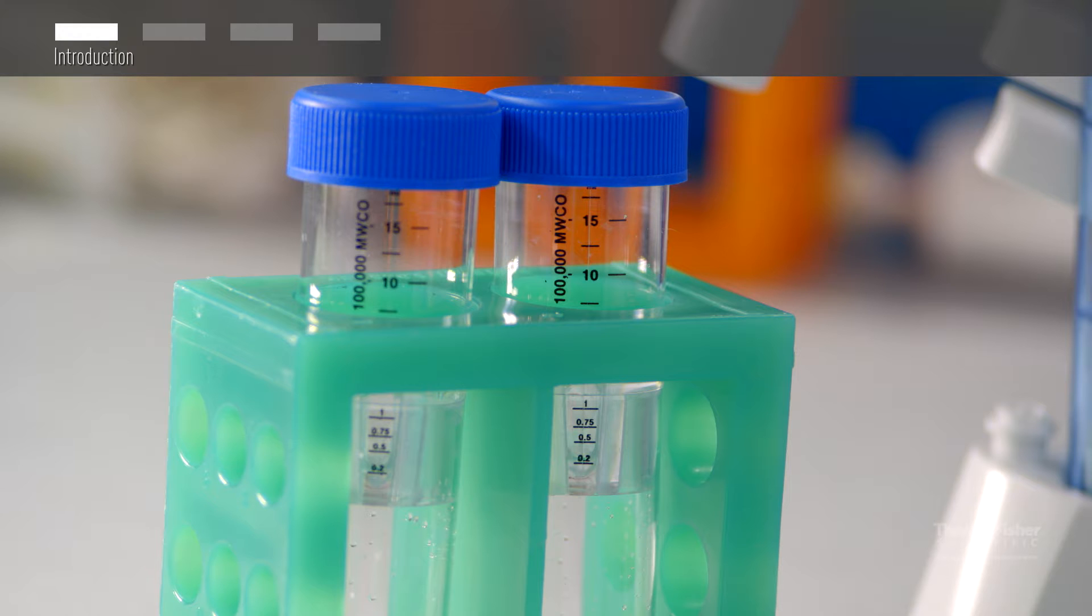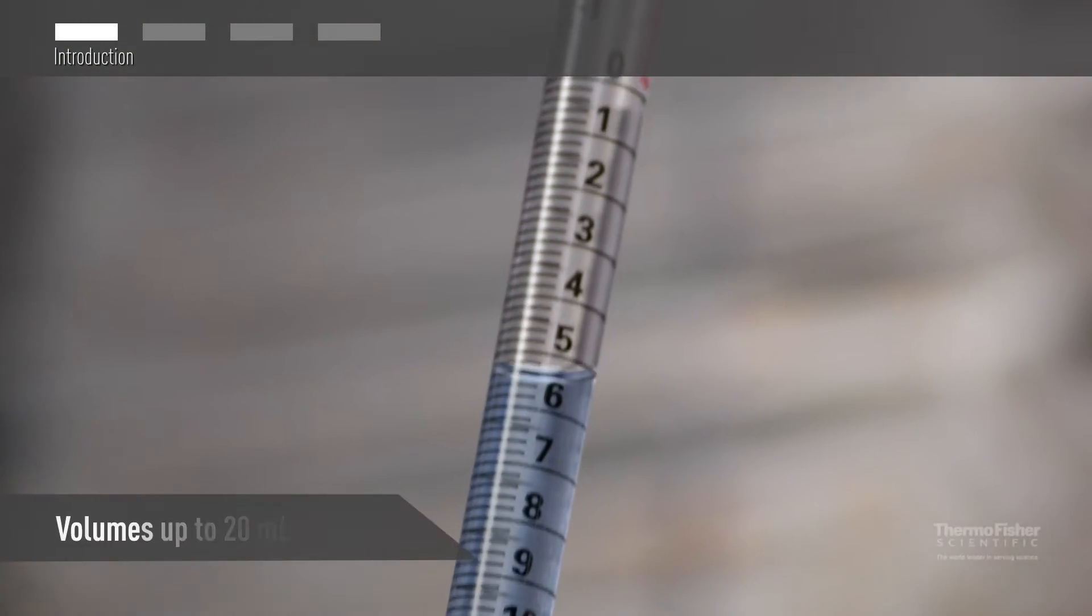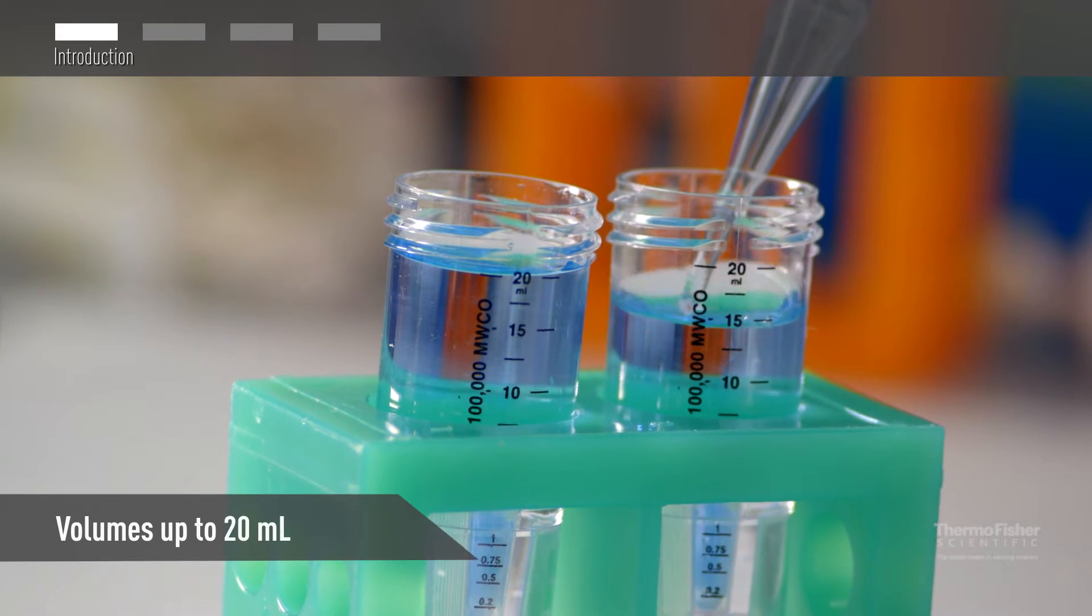In this video you will see how to concentrate your protein solution using the Thermo Scientific Pierce protein concentrator for sample volumes up to 20 mL.